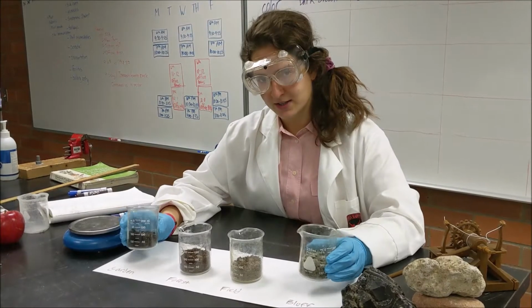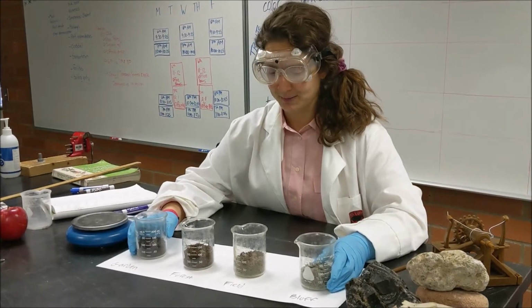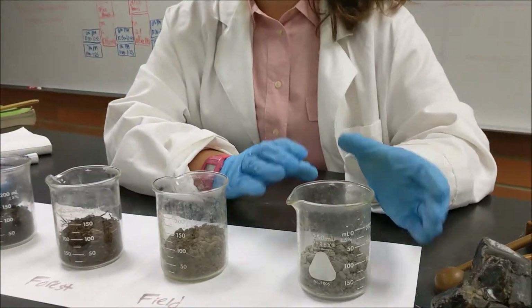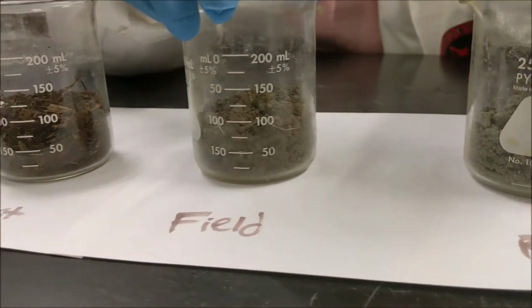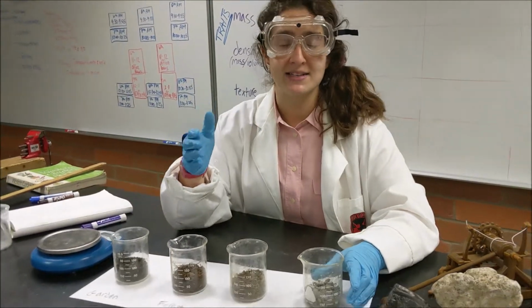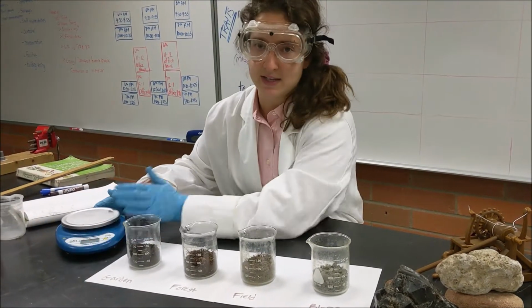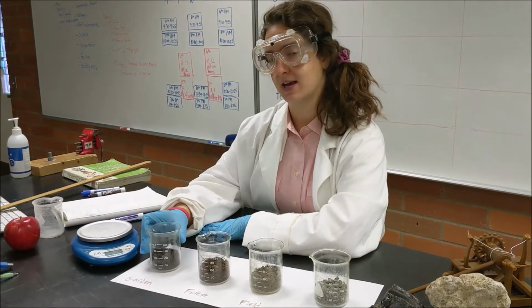In order to measure our next physical properties, we need to talk a little bit about mass and volume. So what we've done here is measure out 100 milliliters of volume, or how much space it takes up in these containers. So each sample is 100 milliliters approximately. That's volume. Now, we also need to measure the mass. That's how much something weighs. And to do that, we're going to use this scale. It's a digital scale, and it measures in grams. Let's measure the mass of this first sample here.